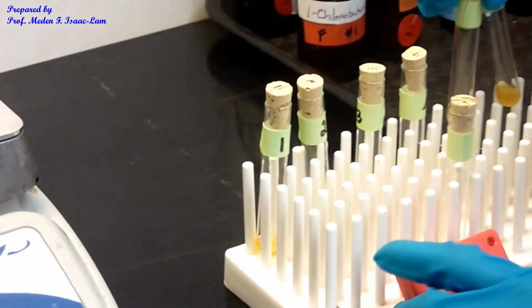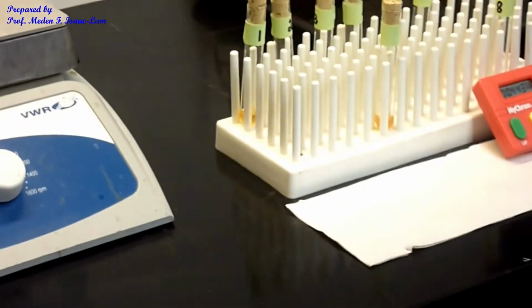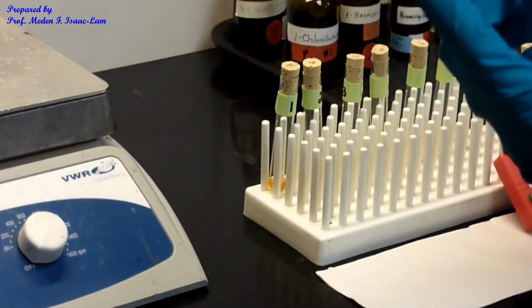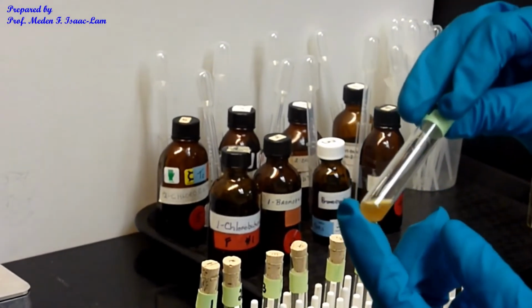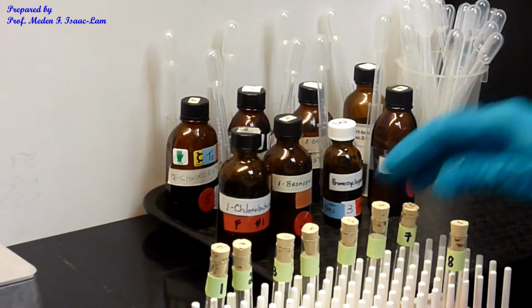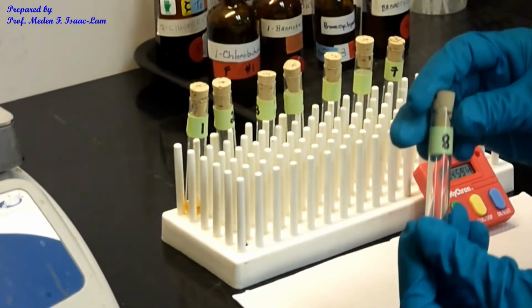So this one is already done. All right. And let's see. So right now, I see something, but not quite. So let it sit for another 5 minutes and we'll compare.